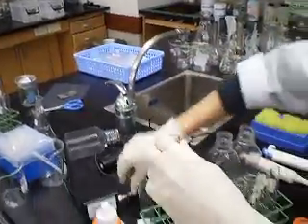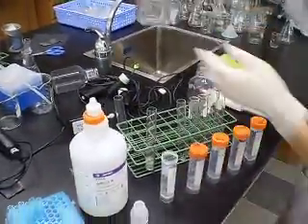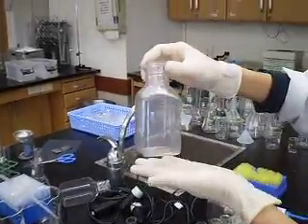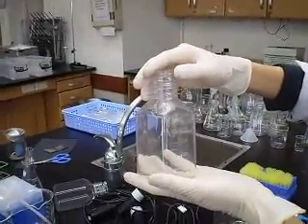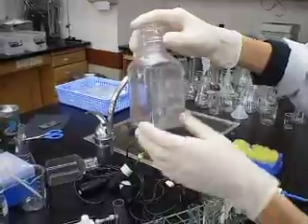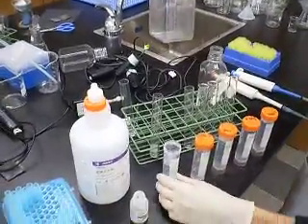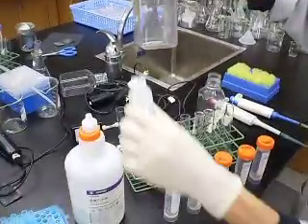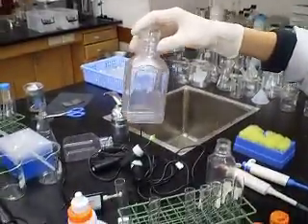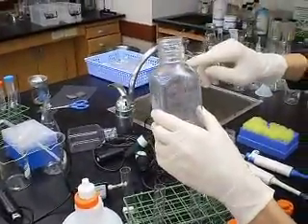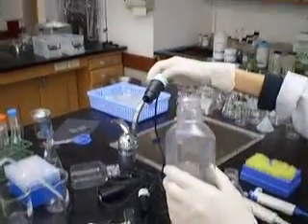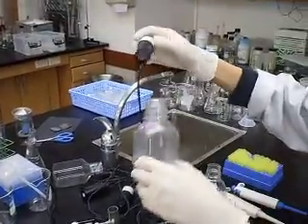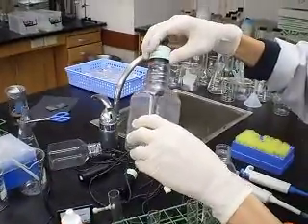And another part of the experiment is we're going to put the hydrogen peroxide into this big container. Same one, we're going to use greater volume, maybe 15 or 20 mL. Add about 100 microliter of catalase and measure the pressure build up using oxygen sensor. Because this is the oxygen sensor, it fits into this container.